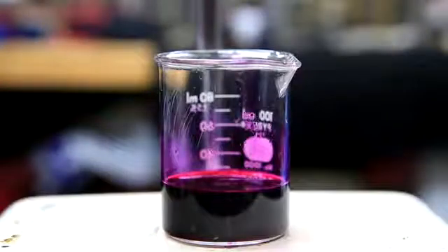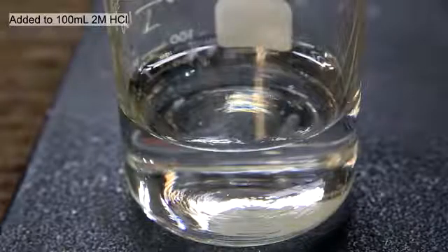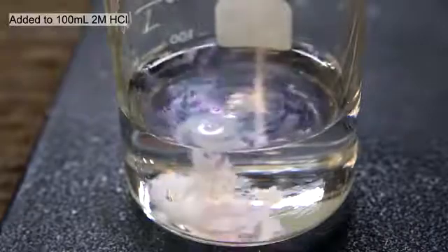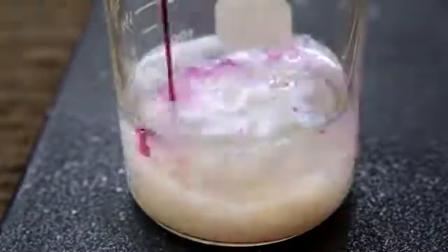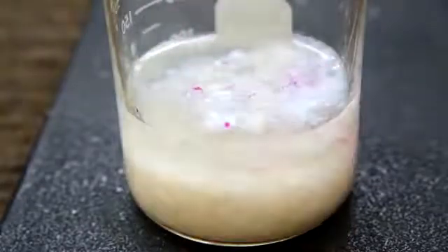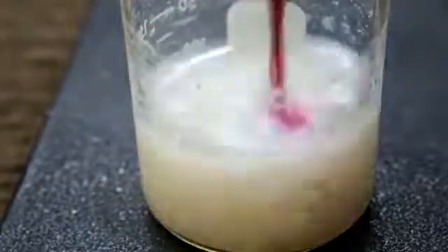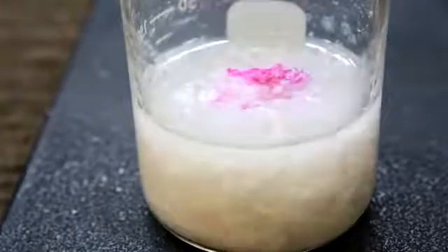This solution is very concentrated in phenolphthalein and is almost black. The phenolphthalein solution is then poured into 100 milliliters of 2 molar hydrochloric acid. This converts phenolphthalein back to its non-salt form, which is insoluble in water and causes it to crash out. This was then vacuum filtered and then dried under vacuum.